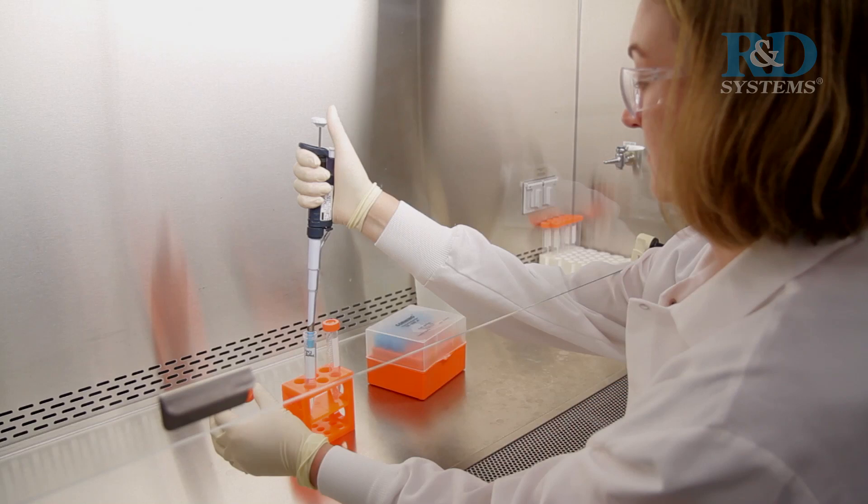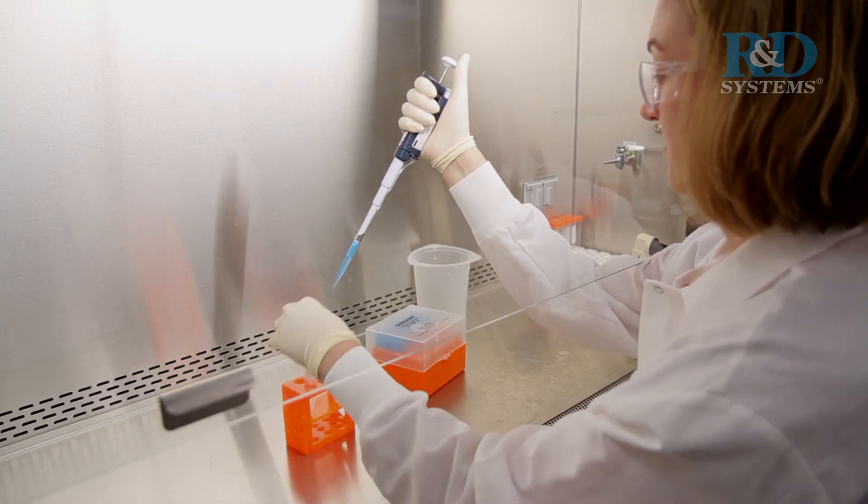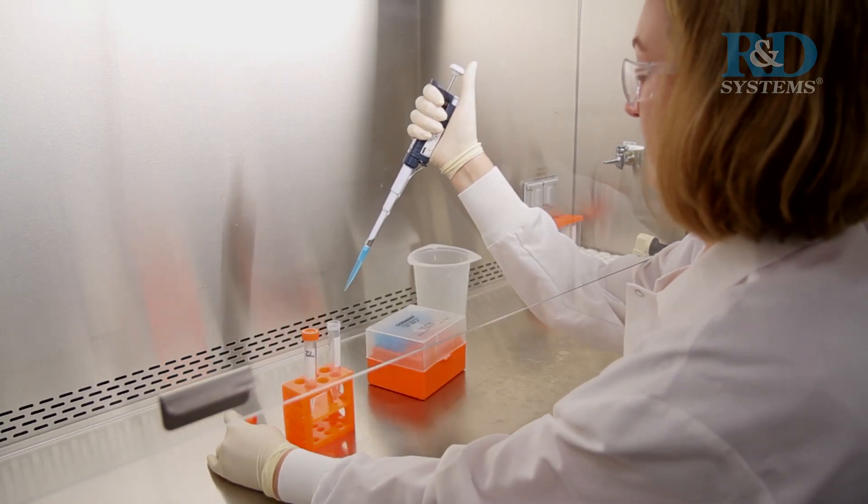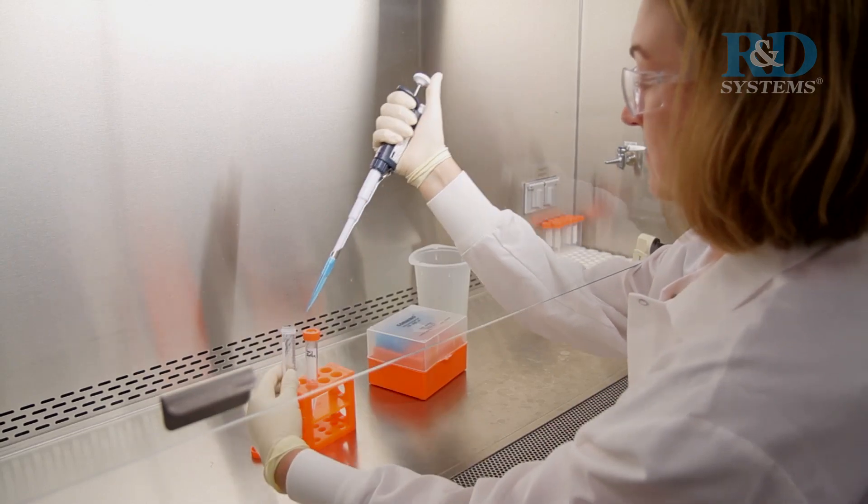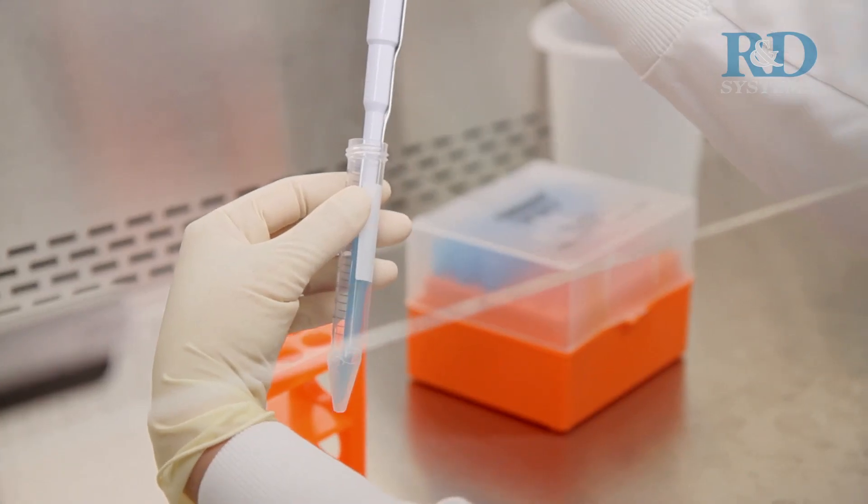Collect lysates from untreated, ligand treated, or inhibitor and ligand treated cells following the guidelines in the Human Phospho RTK array data sheet.